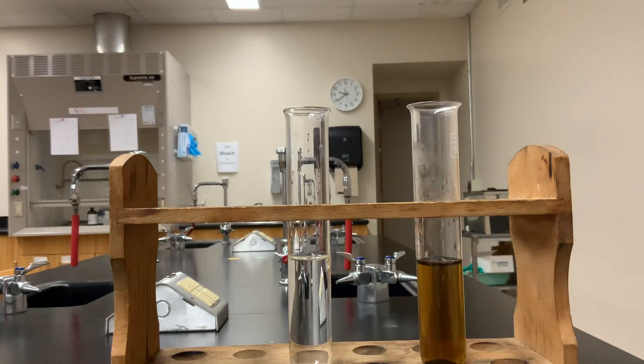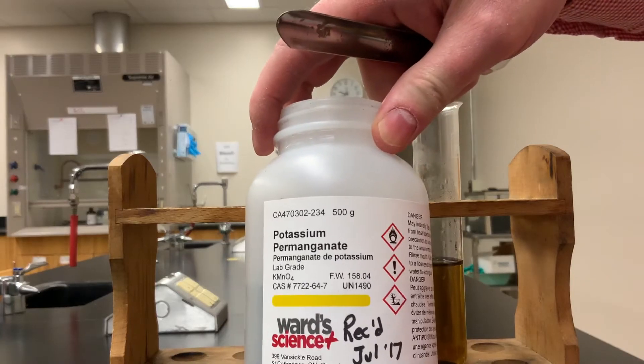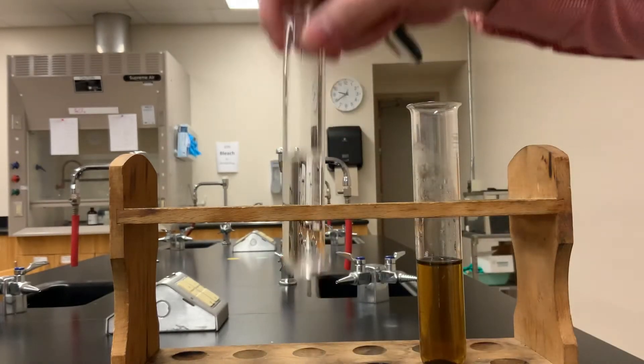All right, so we're just going to quickly test the reaction of potassium permanganate with hydrogen peroxide.